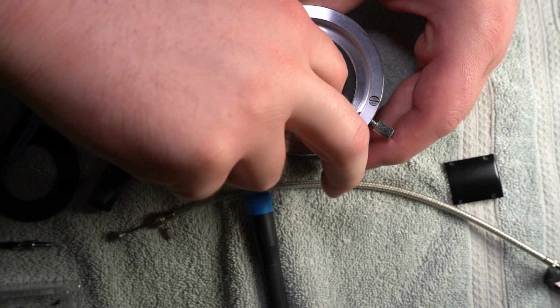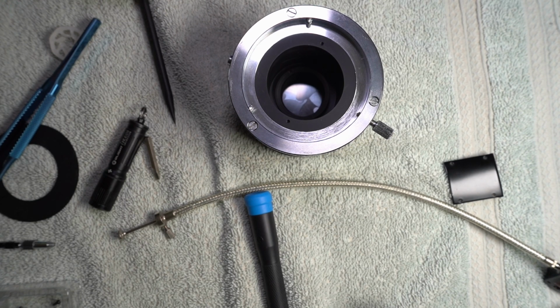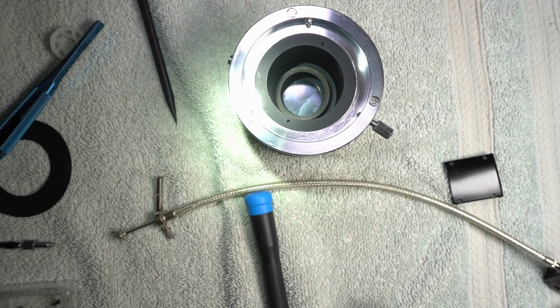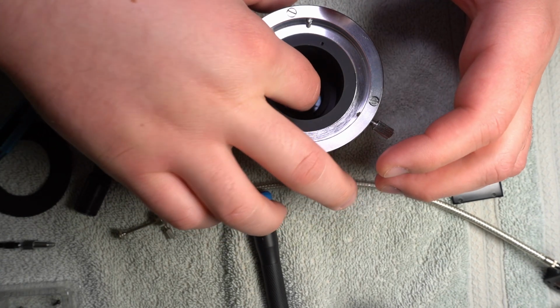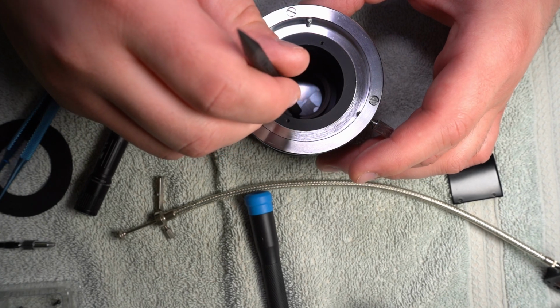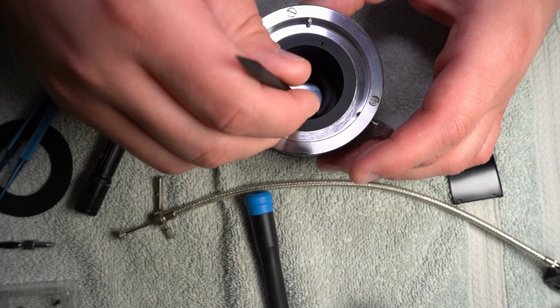Doggone. My hands are like the driest hands in the world, and I think that they actually still have enough oil to be causing me problems. I think you can see that in there now a little bit better. I'm using my little flashlight here to show you, so you can see that I'm having to try and align that, and it's made out of aluminum. This nut is made out of aluminum, and aluminum is very sticky metal. It galls really easily with the threads, and I got it threaded in there somehow.